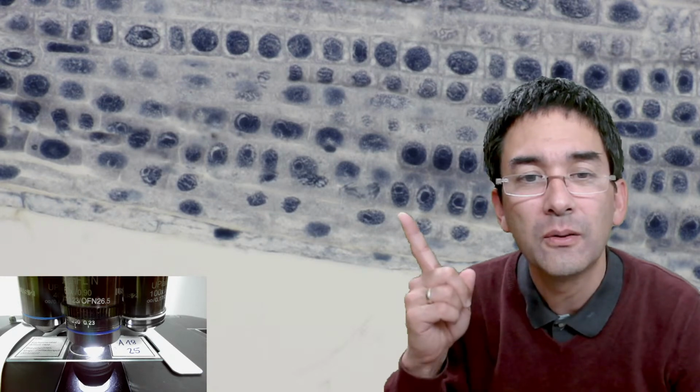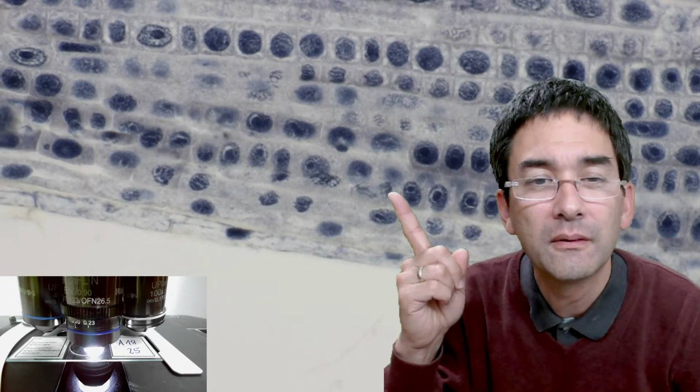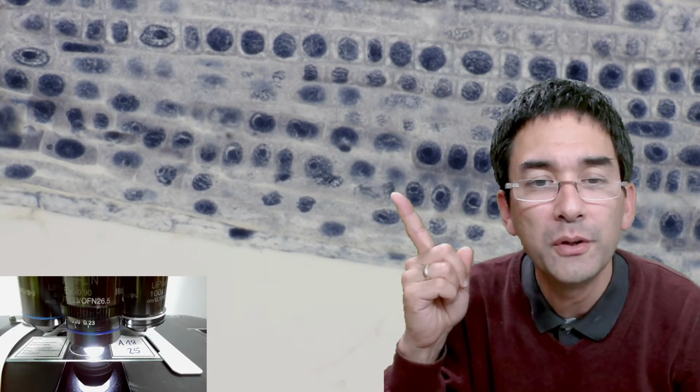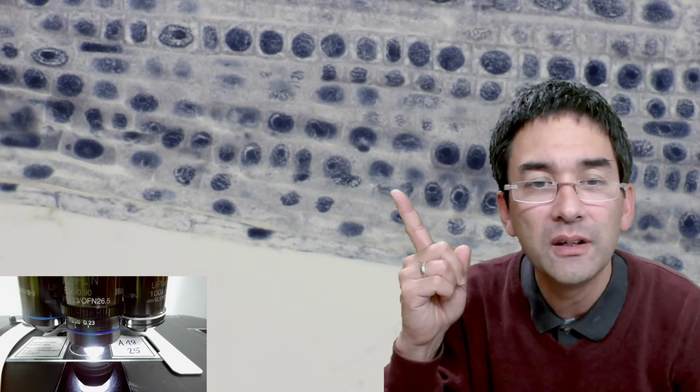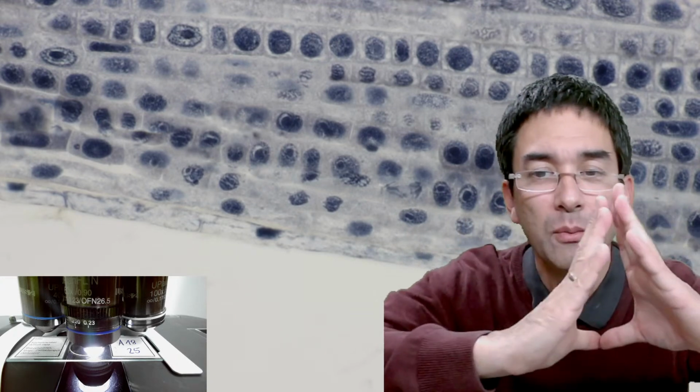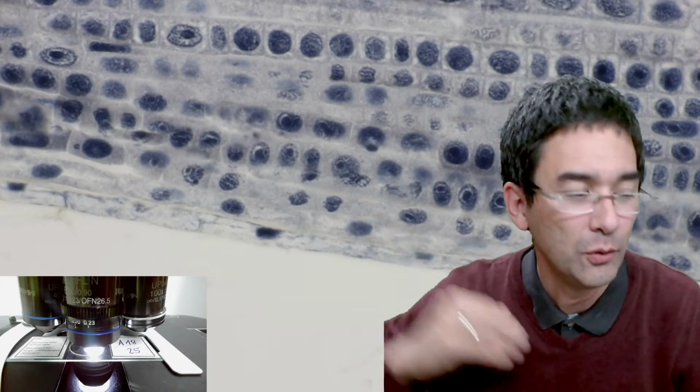And then I found somewhere an anaphase. I'm seeing one, but that's not a very good one. Yeah, it is anaphase. Do you see this here? I need to point to it. You see that they're all exactly at my fingertip. These are chromosomes pointing towards the center. And on the other side over here, there are also chromosomes pointing to the center. So this is basically when the chromosomes are separated and they fold back like this. But honestly, I've seen much nicer pictures of this.